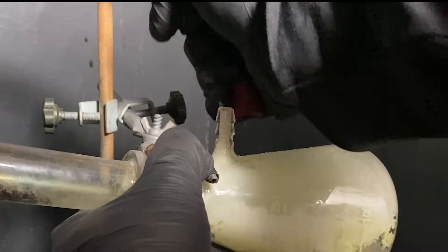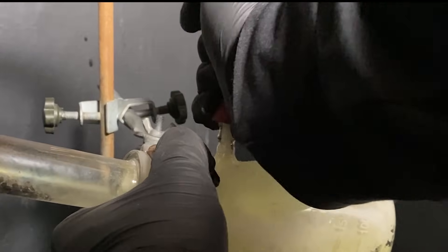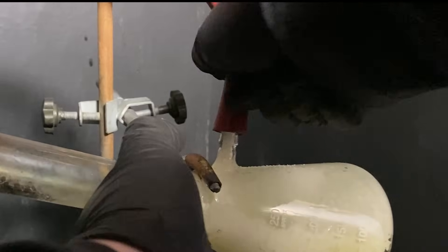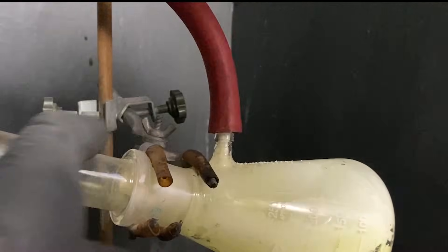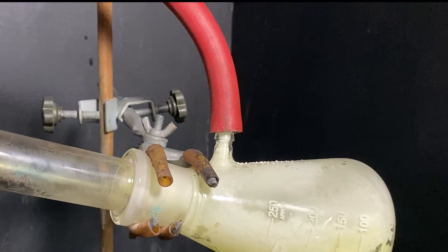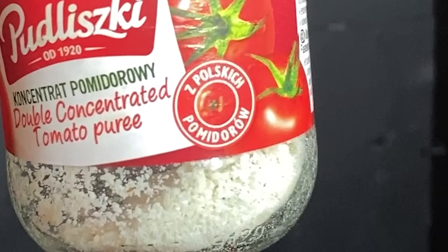Eventually, I've tried unplugging the outlet to see if there's any pentachloride there, and as it turns out, it's pretty much clogged, which could generate some pressure, which could be bad. Anyway, I've stopped the experiment and we're left with 10 grams of phosphorus pentachloride, which was moved into my favorite tomato purée jar.